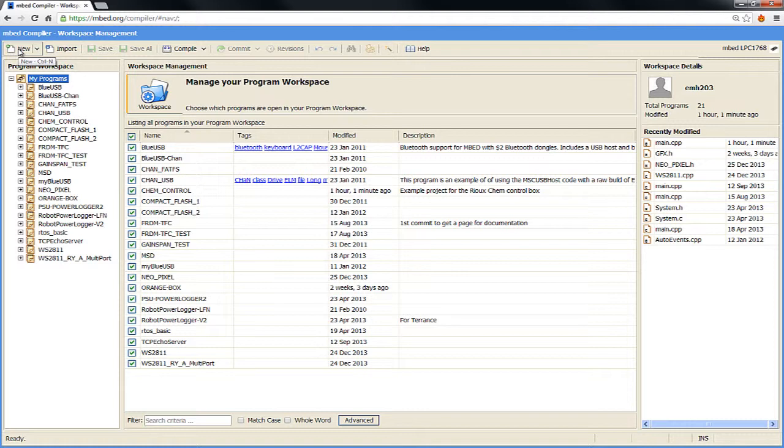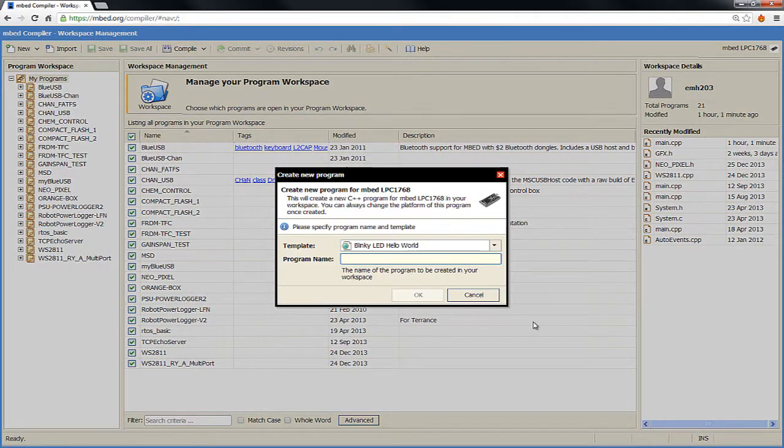Whenever you make a program, you can publish it to their online system so that others can pull it down and use it. It's kind of an open source thing. You can play with this, but whenever you create a new program, by default it'll always give you a template you can use. I'm just going to call this test.